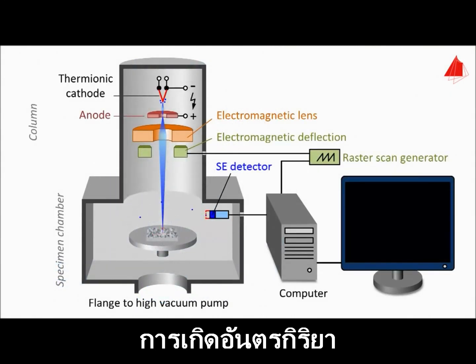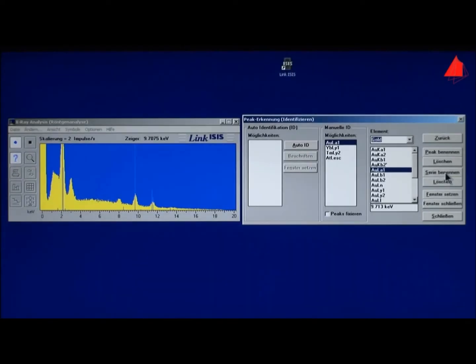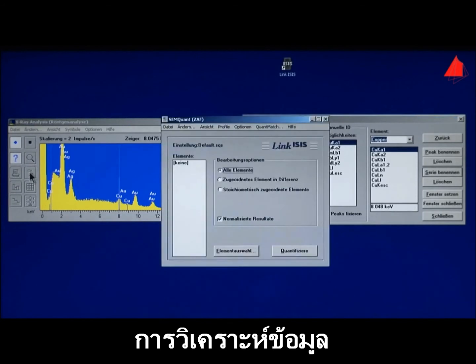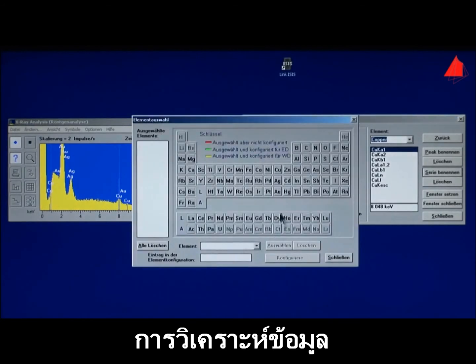So X-ray radiation is generated during the operation of the scanning electron microscope, namely X radiation, which is characteristic for the chemical elements present in the sample. If the energy and the intensity of the radiation are measured with an X-ray detector, then the chemical composition of the sample can be determined. Here the typical X-ray spectrum of the piece of jewelry builds up. Chemical analysis is then carried out using sophisticated methods with the help of a computer. Certain limitations must indeed be minded, but it's definitely a fine method, and above all, it is completely non-destructive, and even very small spots on a sample can be analyzed.